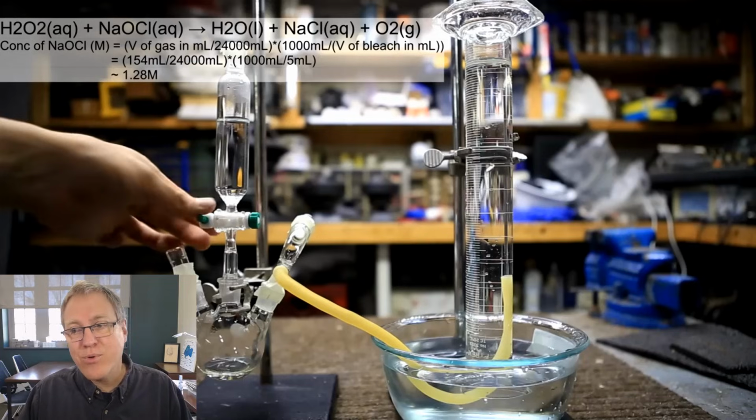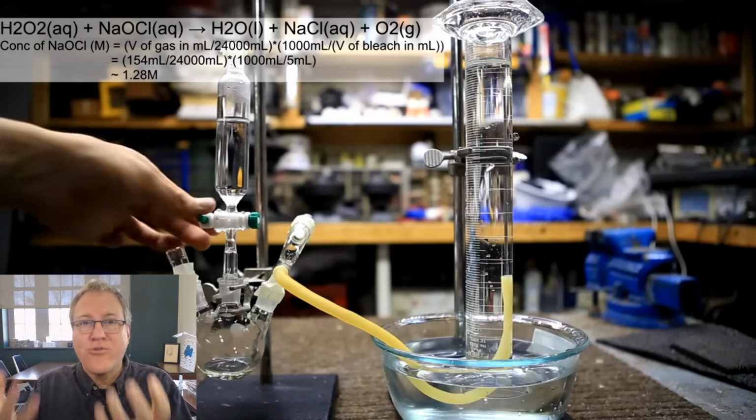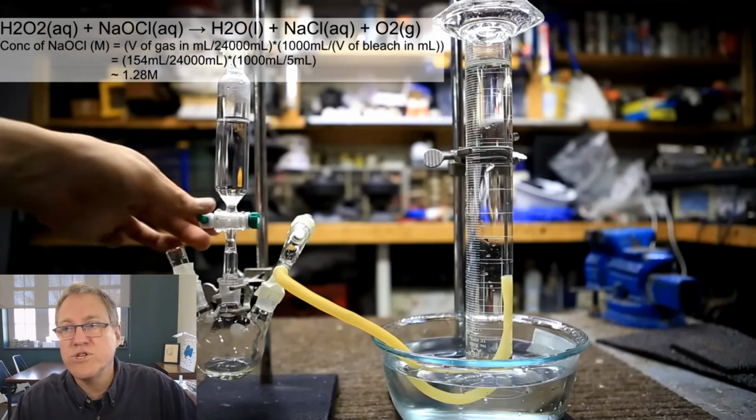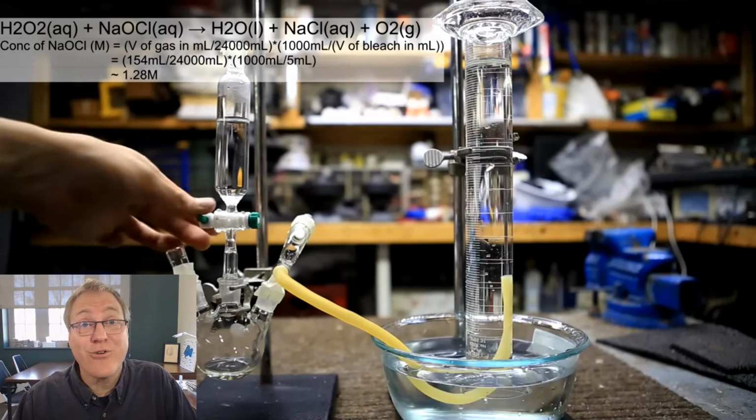And through that amber tube, he's going to bubble that gas up into that graduated cylinder, and that's going to force water down out of the graduated cylinder, and he can measure the change in volume, and that change in volume tells him how much oxygen he's formed. So this is a titration of sorts. It's an M1V1 equals M2V2 type calculation, and then he has to throw in a little perfect gas law, which he'll describe.